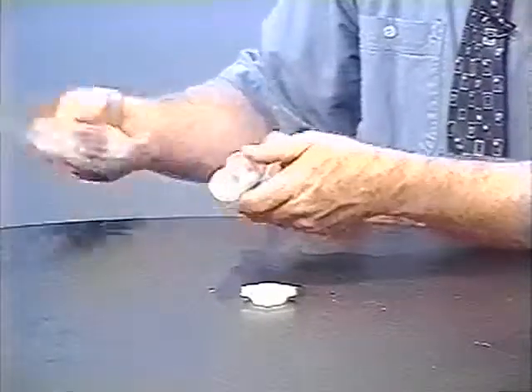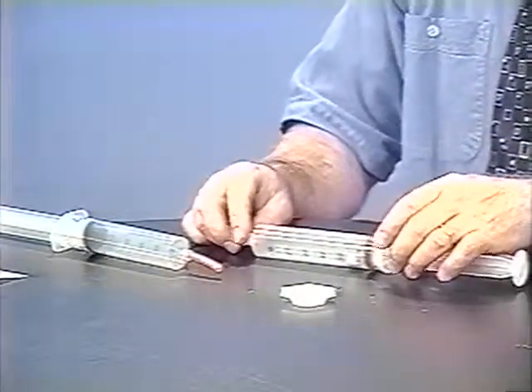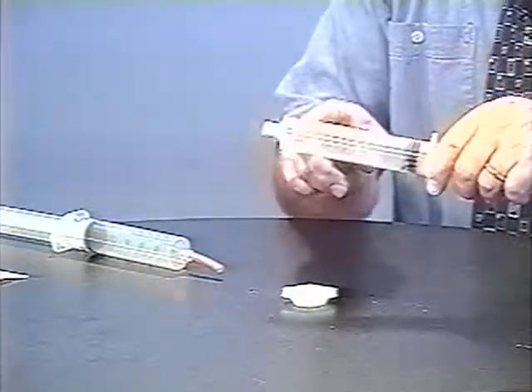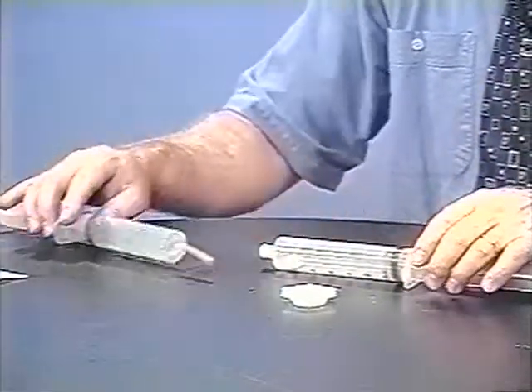I've got some hydrogen here, and again the oxygen from before. I'll perform the transfer — I want to mix these two to one. Notice in the hydrogen syringe, I've got the little vial cap that was there from the generation of the hydrogen gas. We'll use that to help mix the gases.